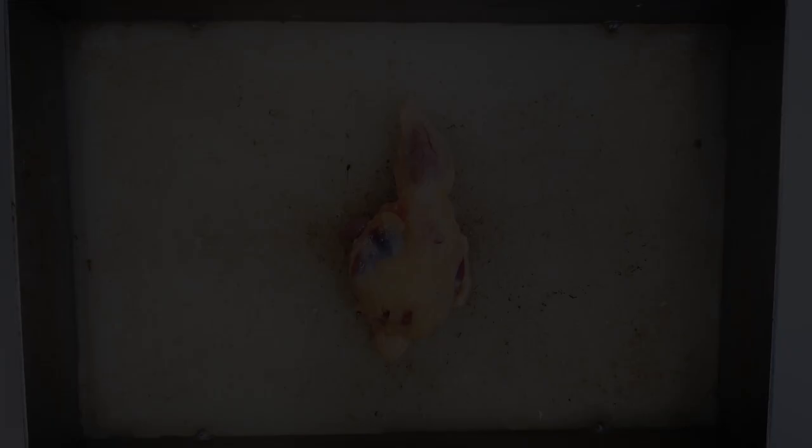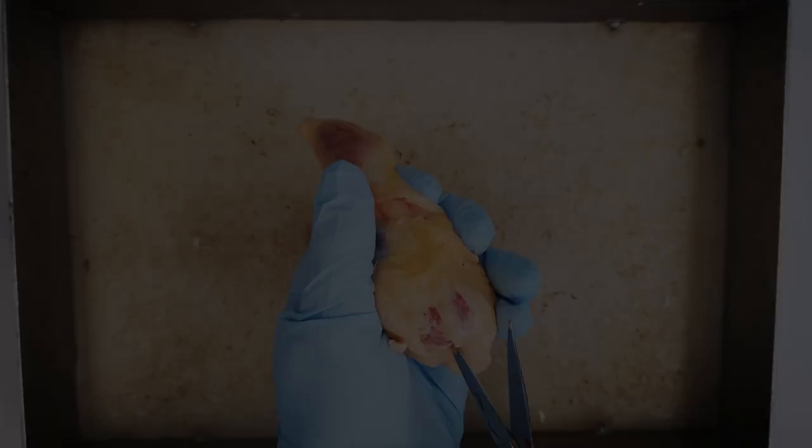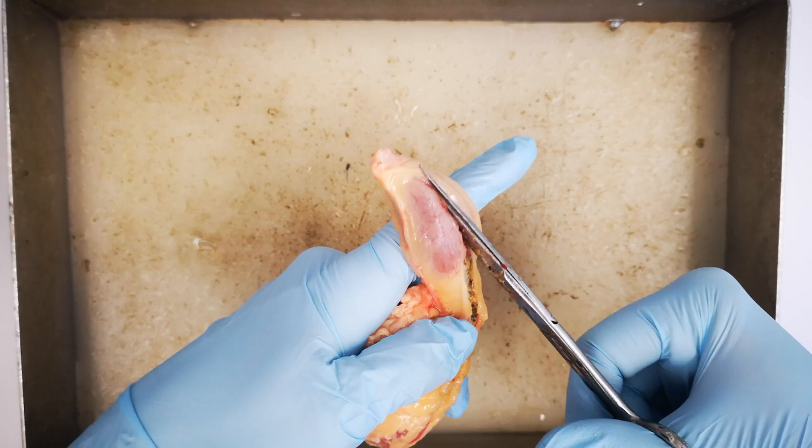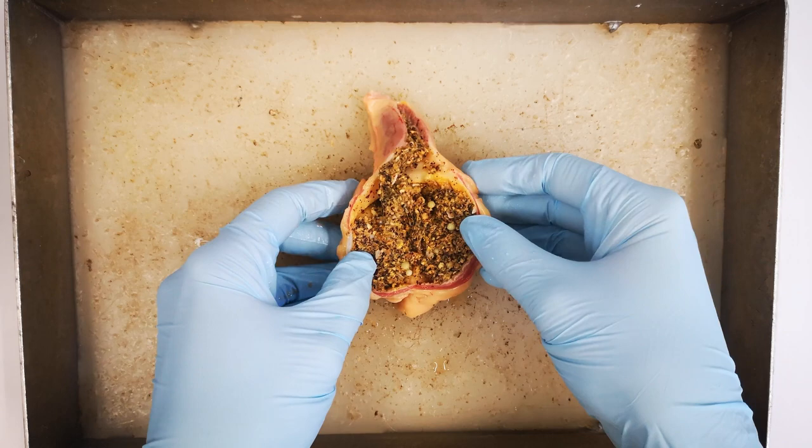The gizzard is an organ with thick muscles in the digestive tract of birds and crocodilians. An analogous but not homologous structure is also present in some fish and even invertebrates such as cockroaches or crustaceans. A distinct gizzard is found mainly in herbivorous birds, especially grain eaters. The gizzard serves to chop up the food and thus also as a kind of substitute for the chewing carried out in other animal groups with chewing teeth.